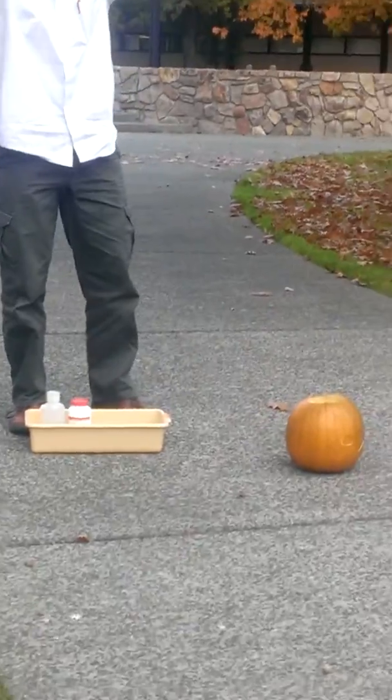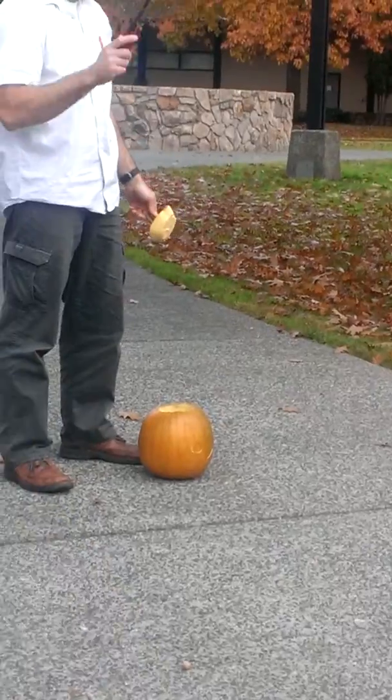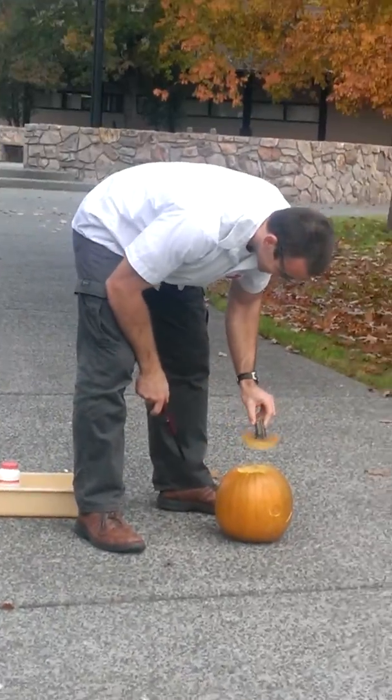10, 9, 8, 7, 6, 5, 4, 3, 2, 1. What the hell? Wait, what, you count from 20? Oh my goodness! And my eyebrows are singed. Not the smartest thing in the world. All right, have fun. That's fine.